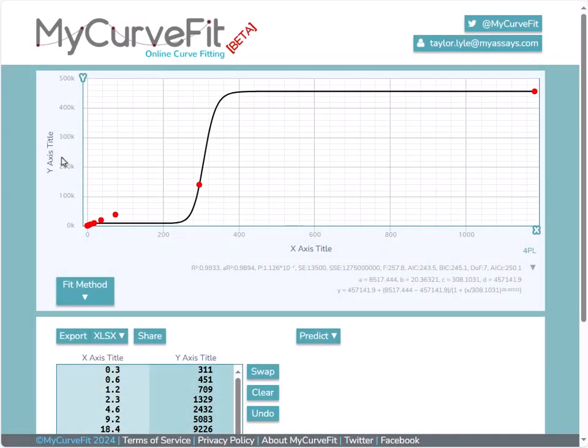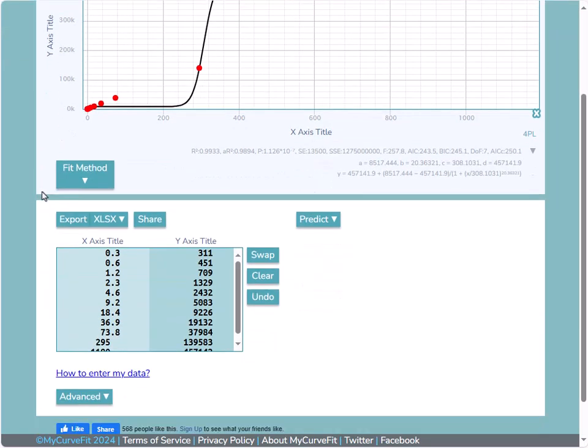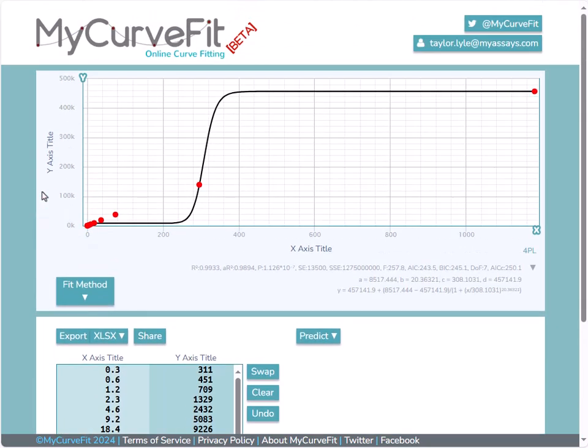In this video, I'll go over when it might be appropriate to apply a log10 transform to your data and why it might be necessary. I've already logged into MyCurveFit.com and have entered my data. I'd like to chart this data using a 4PL fit, but by looking at the chart, you can see that the fit line doesn't really model my data.